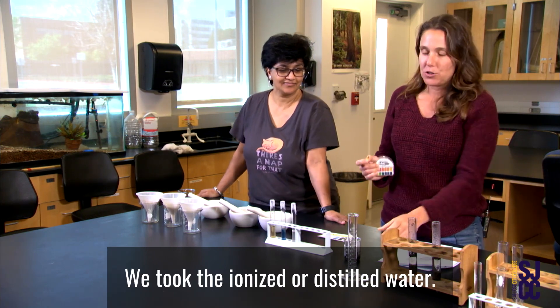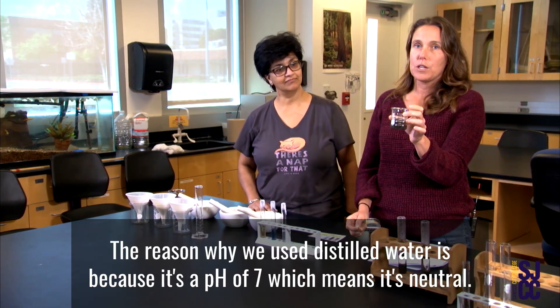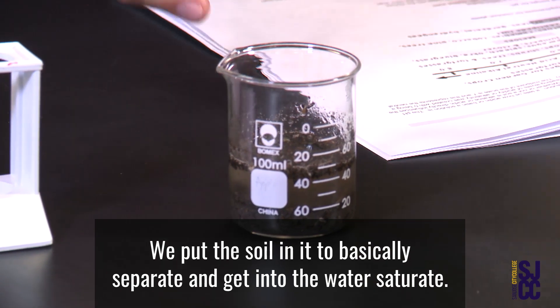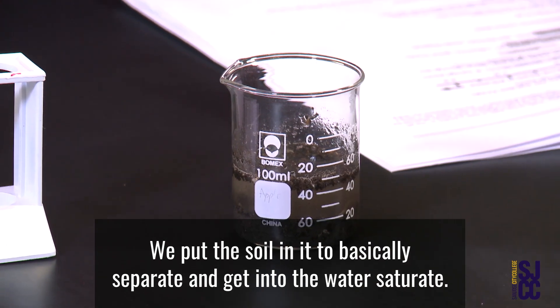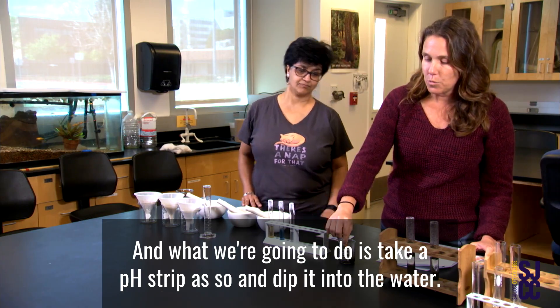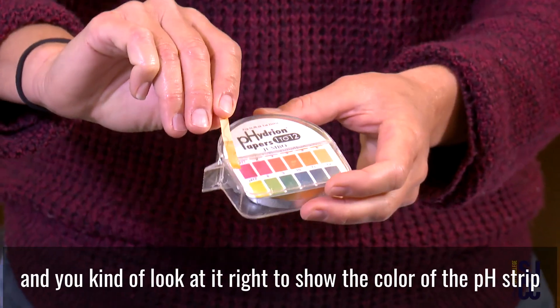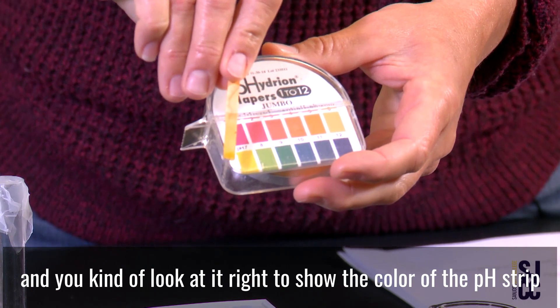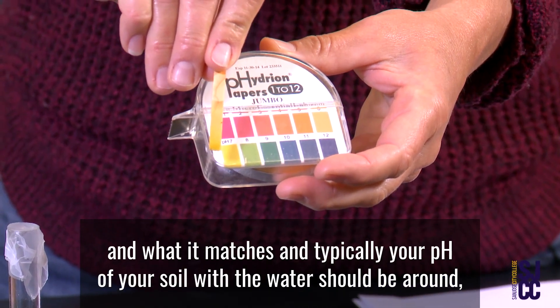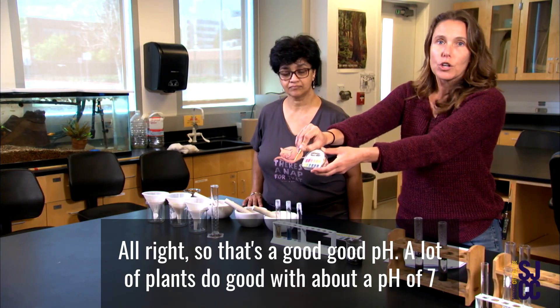We are going to do the test. We took deionized or distilled water — 30 milliliters of it. The reason we used distilled water is because it has a pH of 7, which means it's neutral. We put the soil in it to basically separate and saturate into the water. Then we take a pH strip and dip it into the water for about a couple of seconds. You come back and look at it to see the color of the pH strip and what it matches. Ours is about seven.